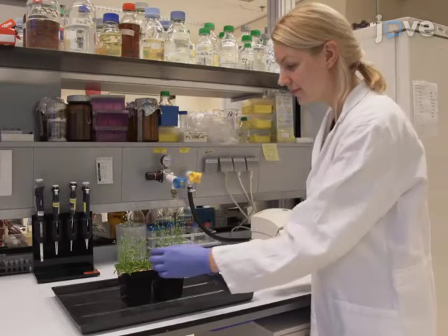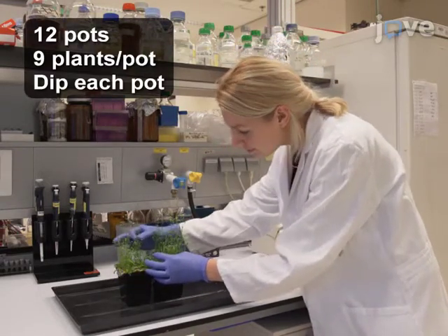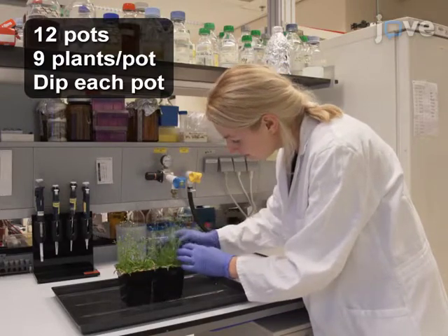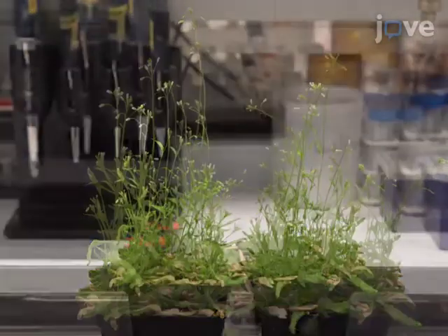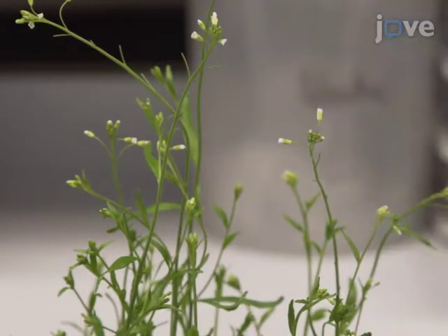To prepare the Arabidopsis plants for transformation, grow Arabidopsis plants in a greenhouse or climate-controlled growth chamber until they are flowering. Clip the first bolts to allow more secondary bolts to emerge. Plants are ready for dipping 4 to 6 days after clipping, when the plants have many immature flower heads and not many fertilized siliques.